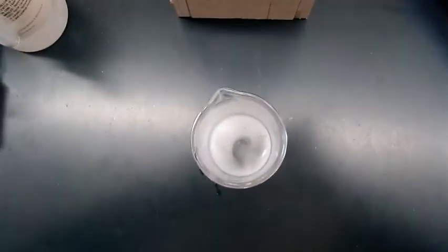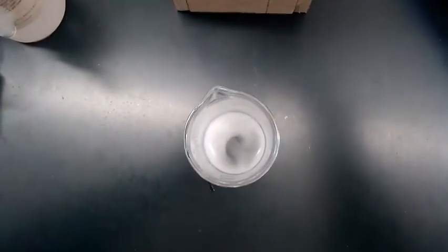So we have two reactants, in this case HCl, hydrochloric acid, and marble, calcium carbonate, and it makes three different products. It makes carbon dioxide, which is a gas, and those are the bubbles, water, which we can't see, but it's making water, and the other thing is calcium chloride, which is the solution it's creating now. It's an aqueous solution of calcium chloride. So I'm going to show you the handout that we were doing in class that kind of sets this all up.